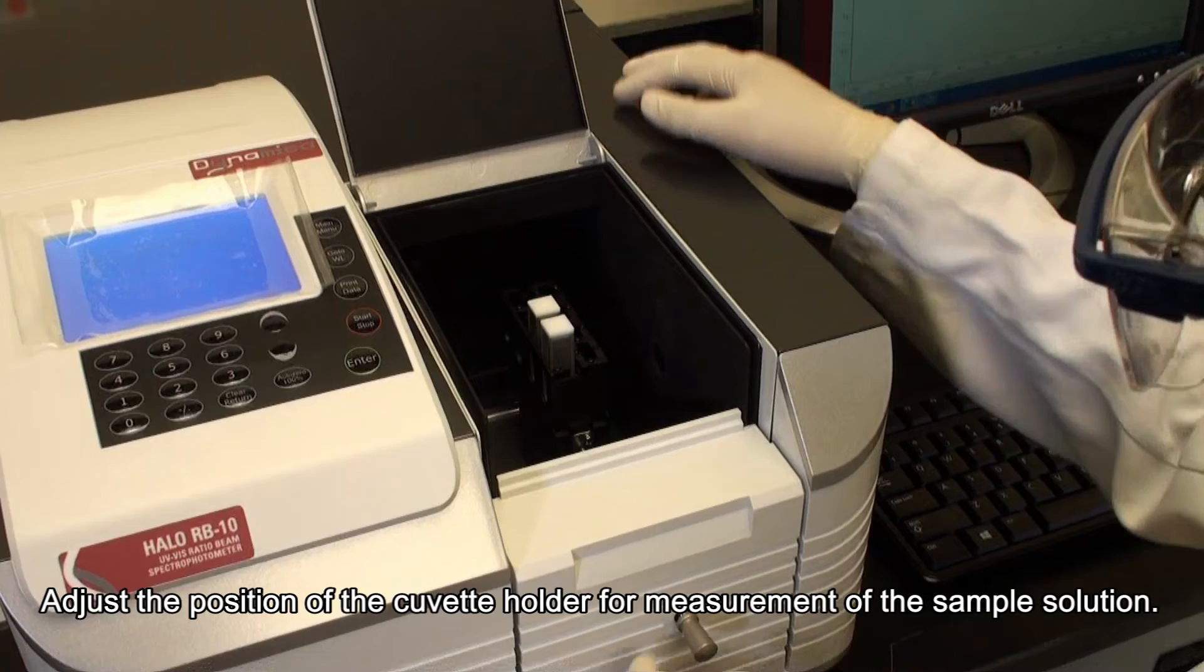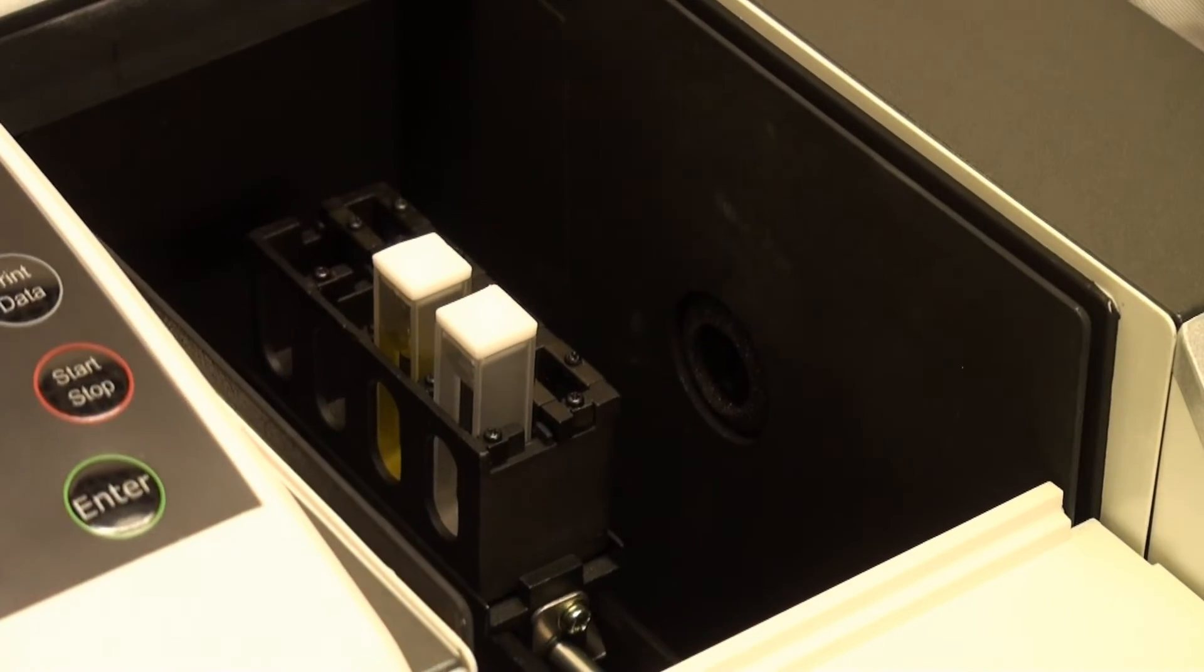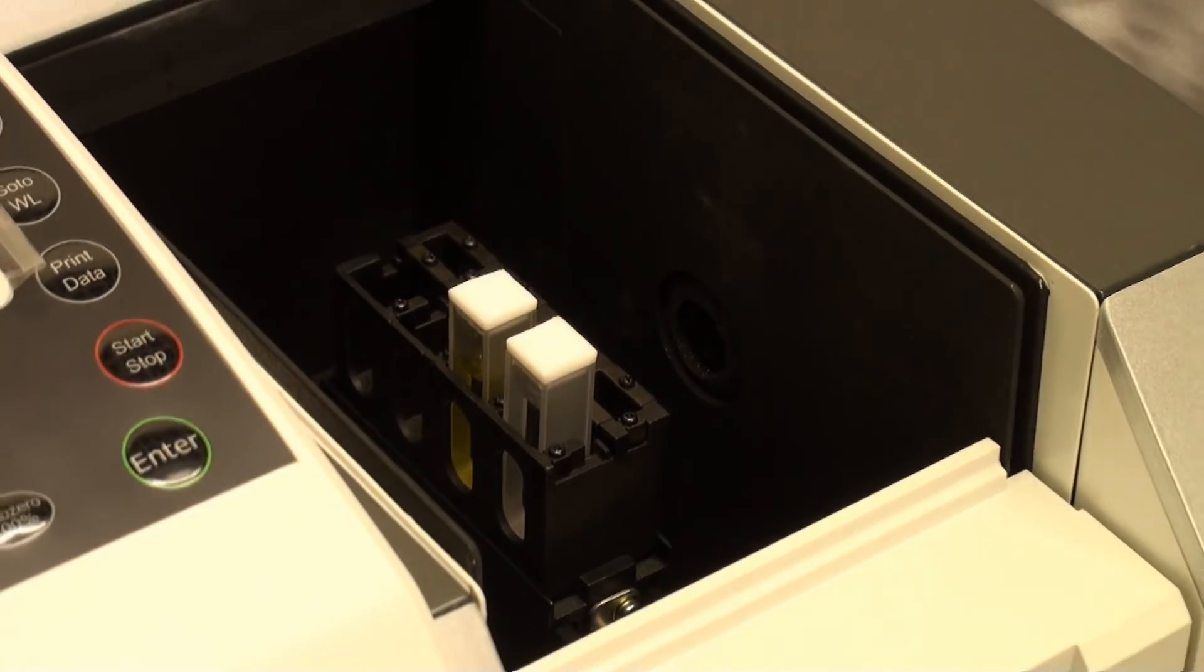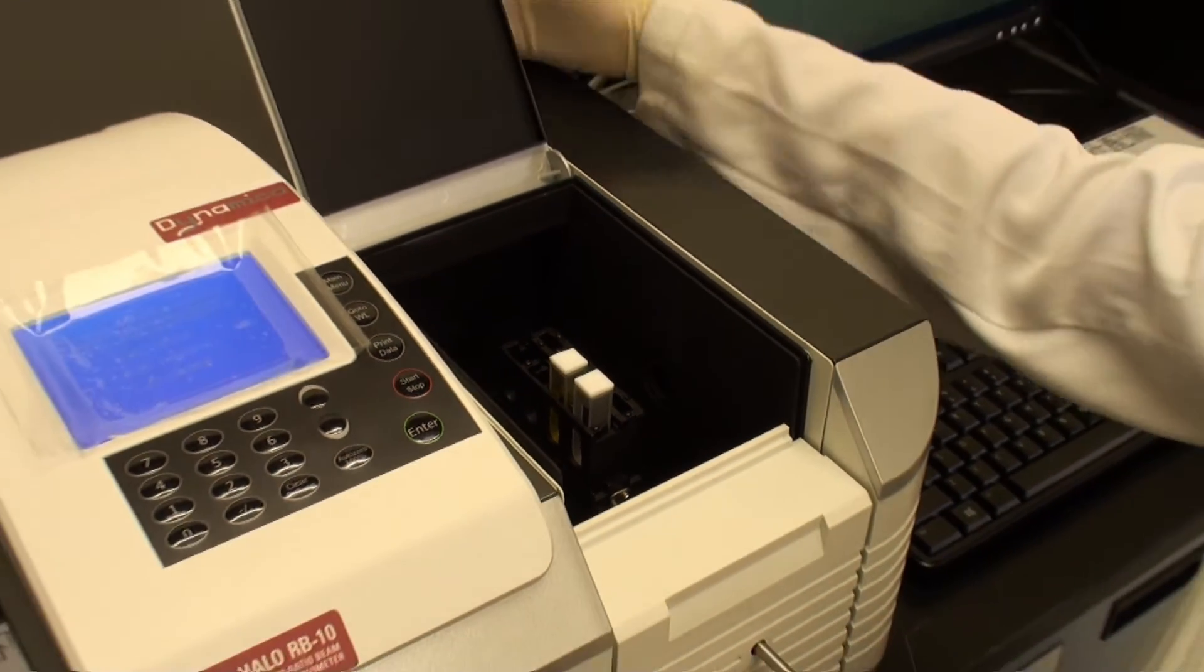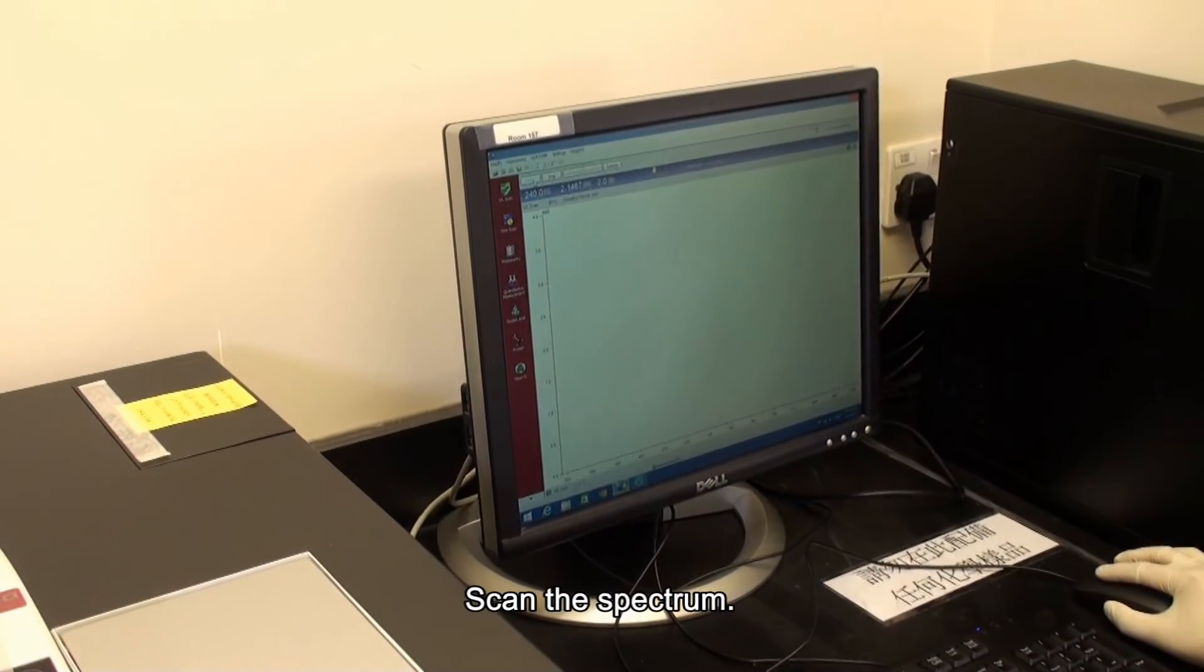Adjust the position of the cuvette holder for measurement of the sample solution. Scan the spectrum.